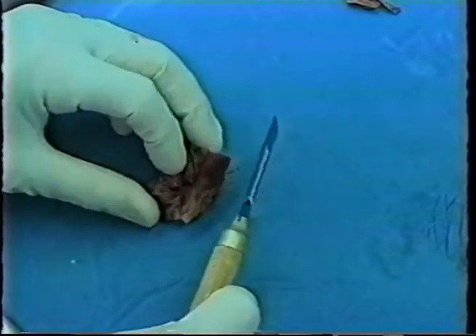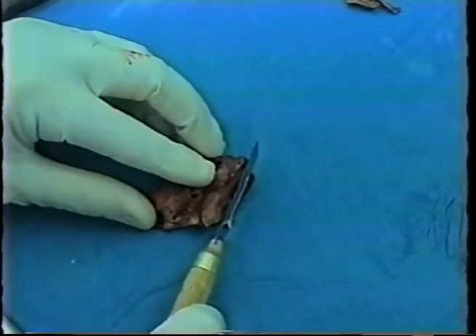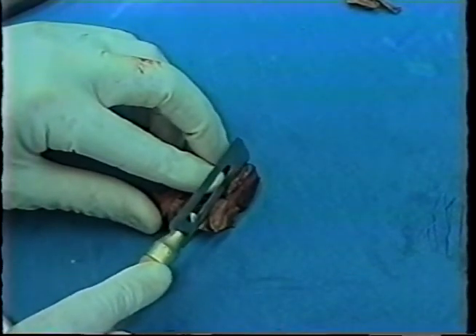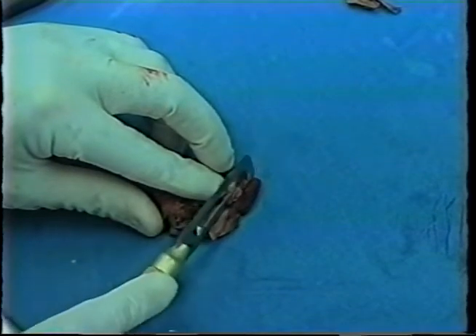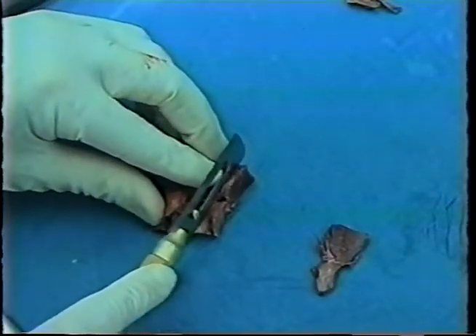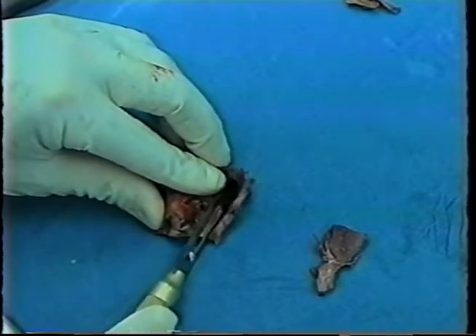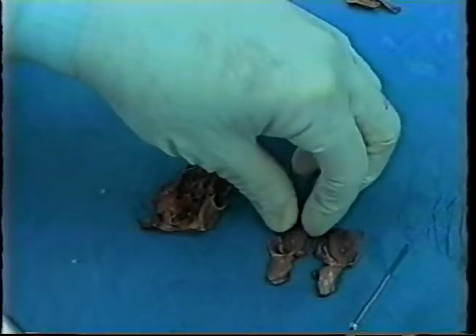And the first cut is a little rough because the posterior edge of this specimen might be a bit rounded off, but one does one's best and tries to get a thin piece of tissue, and one can lay it out as I have, and then we cut approximately every 2 millimeters going anteriorly and lay the pieces out.